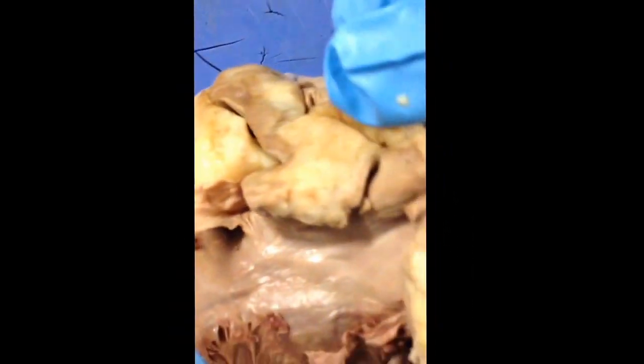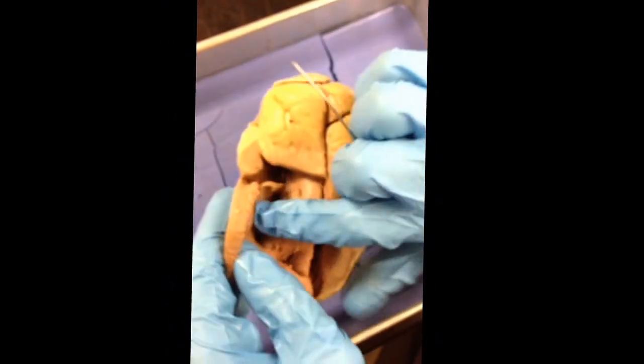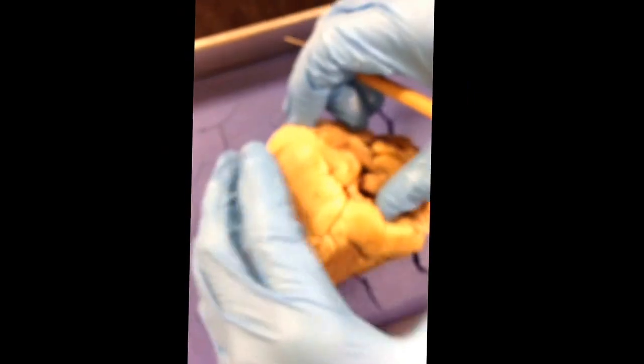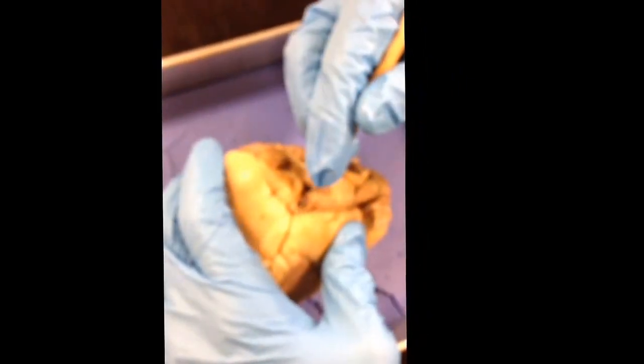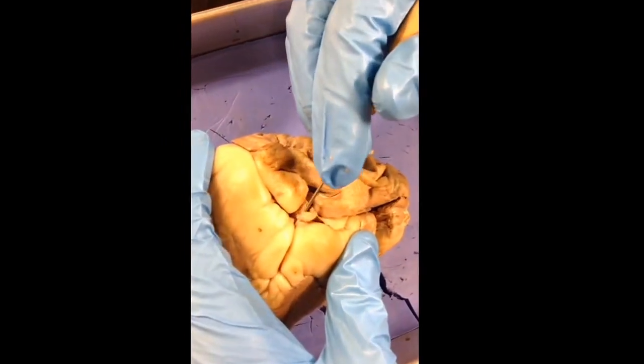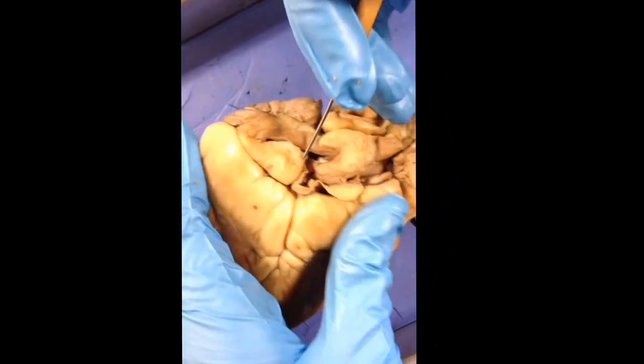and then after that is the right ventricle, which is the bottom half of the right side. And then after that is the inferior vena cava, which is sort of down the path of the superior vena cava. You can't see it as well on this heart since it's cut up, but it should be to the left of the superior vena cava.